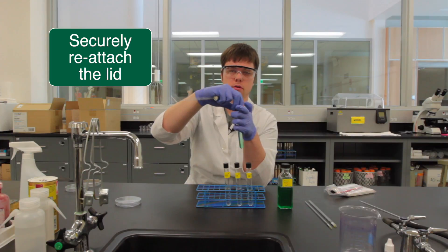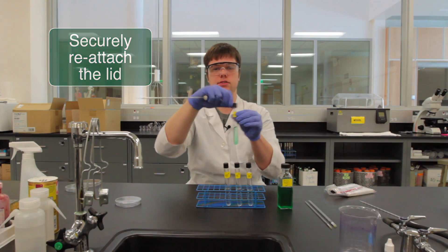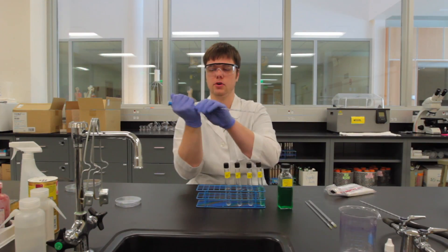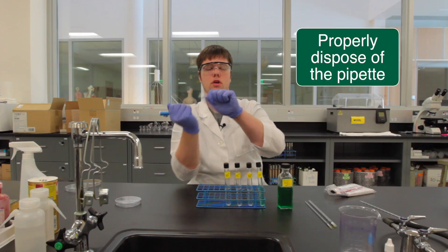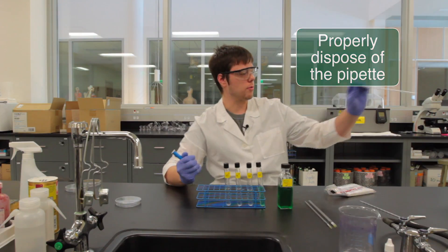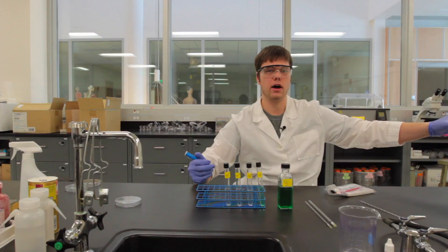I'm going to cap up my test tube and then I'm going to properly dispose my pipette tip or my pipette into the biohazard bin.